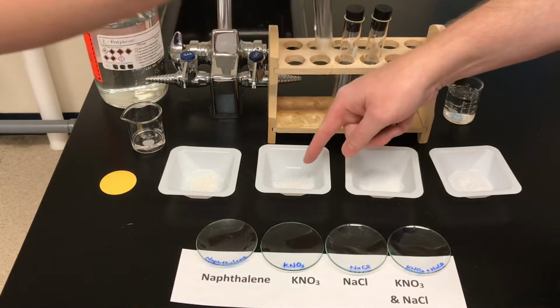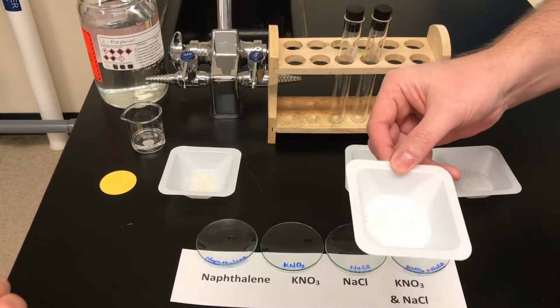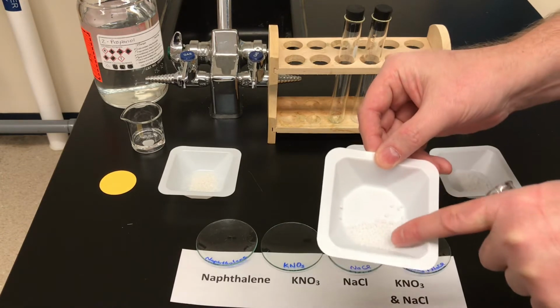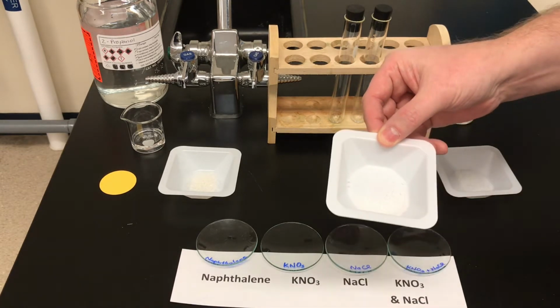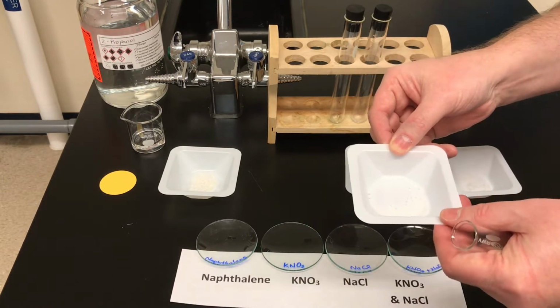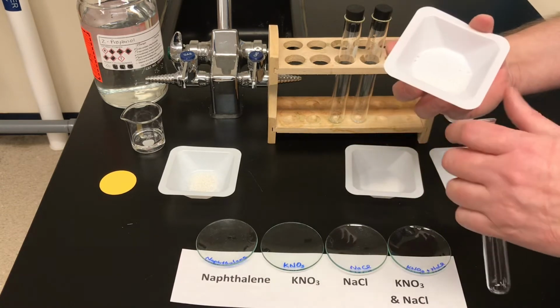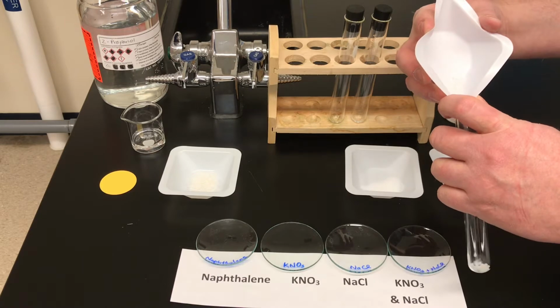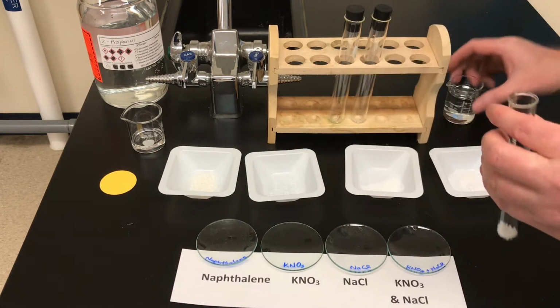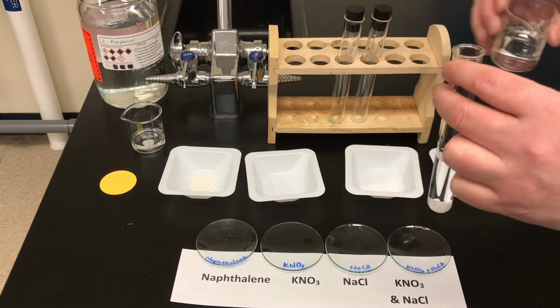So I'm going to take a test tube. I'll take the potassium nitrate to begin with. Now the potassium nitrate that I'm using is in a form that's sort of little beads of potassium nitrate. It's got little round beads in it. It doesn't always look like that. Sometimes it's a crystalline salt, sort of like table salt. It can change how it appears in the solid form. But this one is little beads. I'm just going to pour some or all of that into a test tube, and I'm going to add some distilled water, and Miss Watts can do the same thing with her solution.